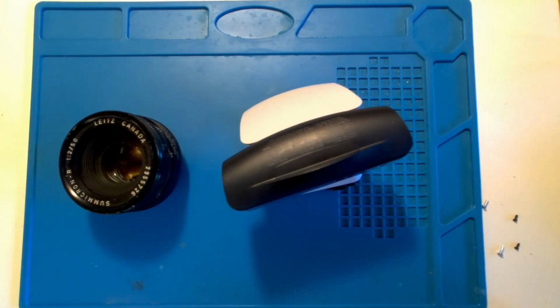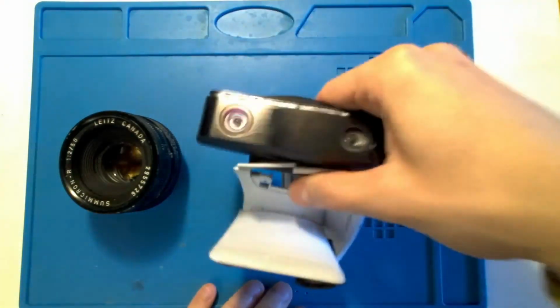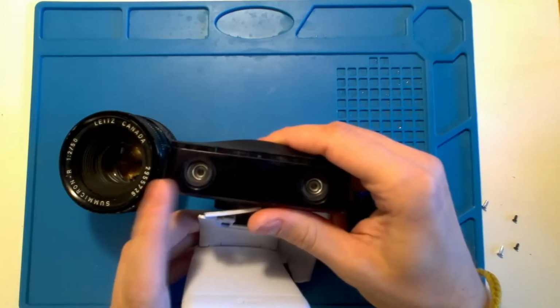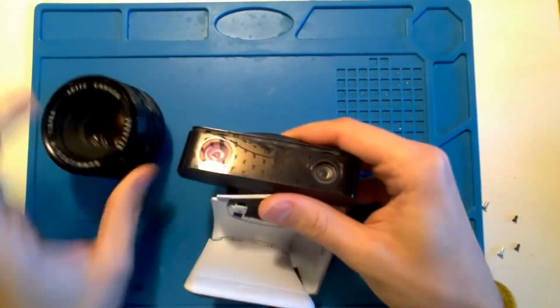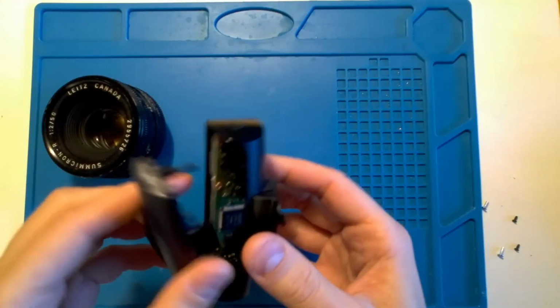I'm filming this on a PlayStation 5 camera. And this is also a PlayStation 5 camera I have here. And I was wondering if I could replace the standard optics with a Leica camera lens. And I've already started to take this apart a bit.